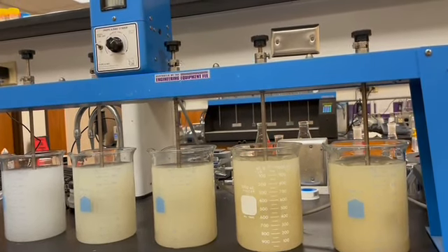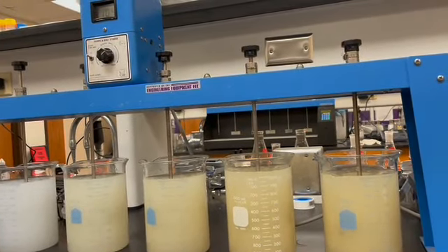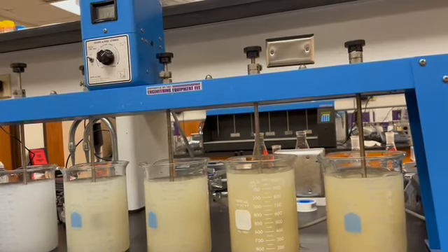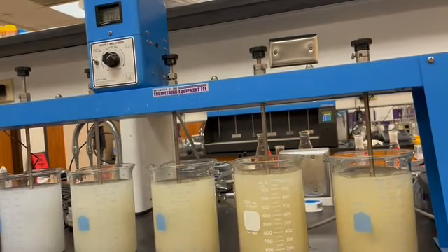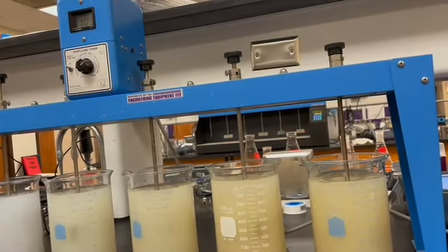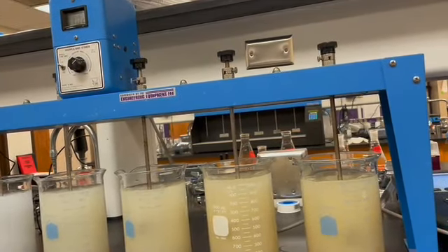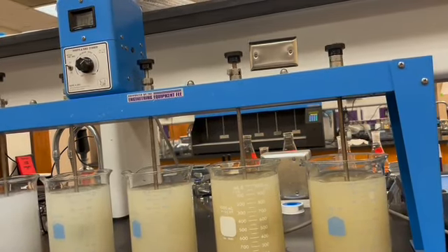So for this demo, we're just doing ferric chloride, but in the lab, your group will collect data for both ferric chloride and alum as coagulants. And in your lab report, you will plot the pH and alkalinity changes for the doses of each coagulant we compare.